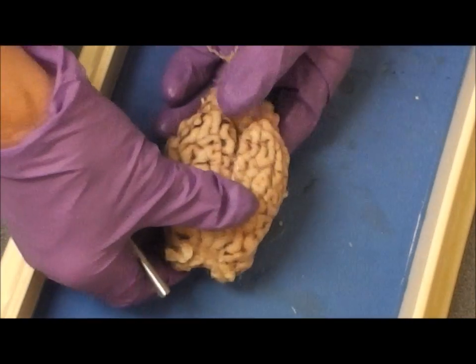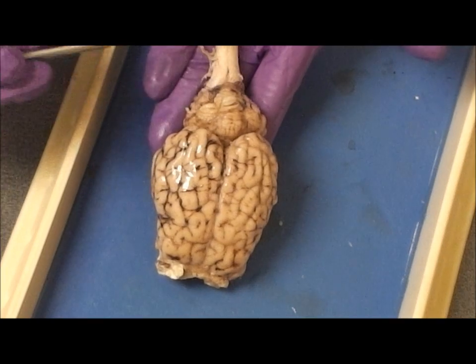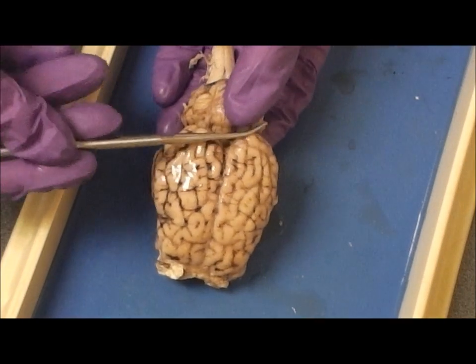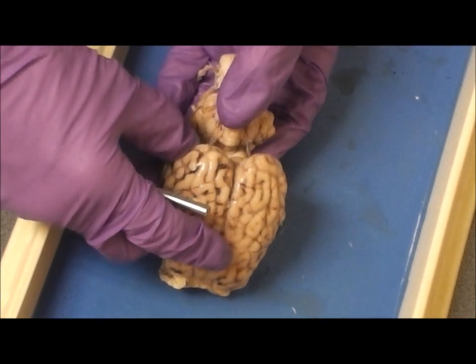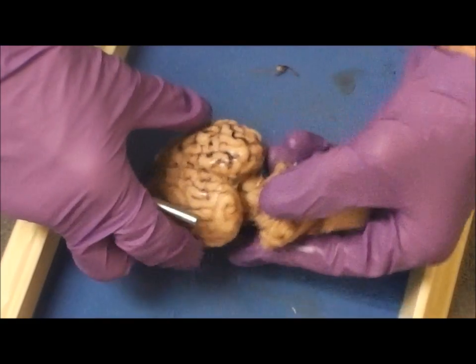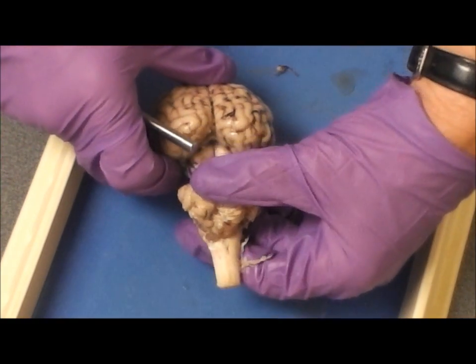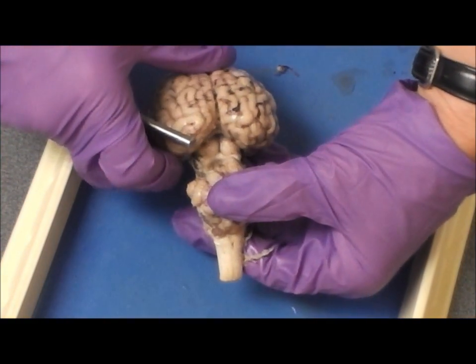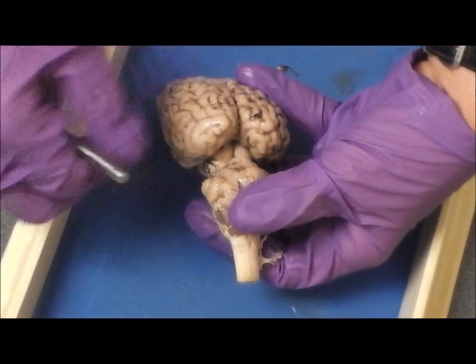Looking dorsally again, we have the cerebellum and the cerebrum. If I peek behind the cerebrum, I can see four bumps — two superior bumps and two inferior bumps.